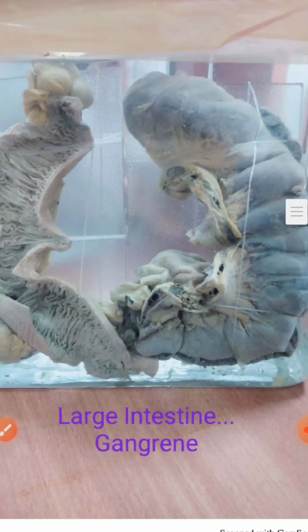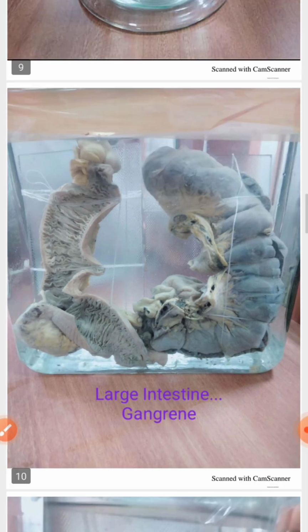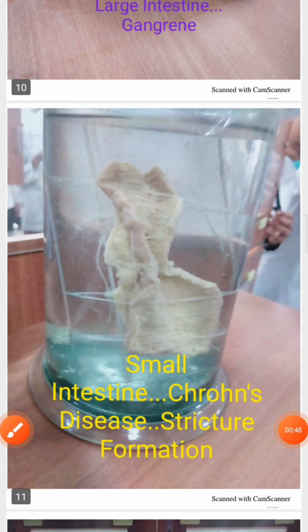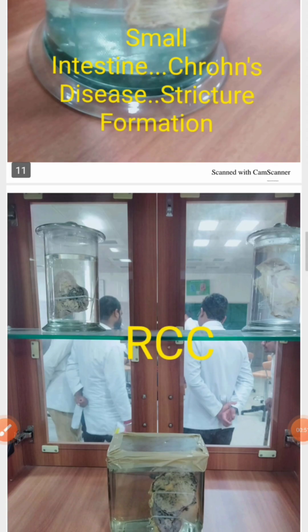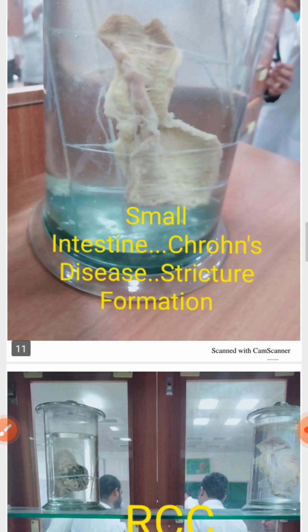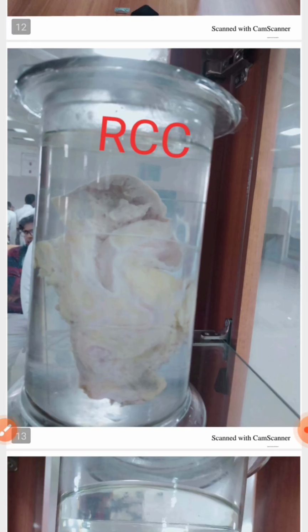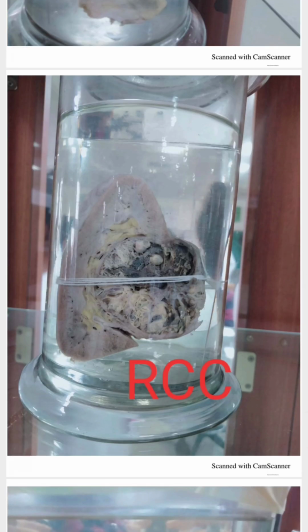So this one is a large intestine gangrene. Majority, whichever it is in your college, they might have already told which specimen it is. Most commonly these kinds of specimens will be very hard, so these things won't be kept. So this is a small intestine, most commonly Crohn's disease. You should know the difference between ulcerative colitis and Crohn's disease. If they kept this intestine, large intestine or small intestine, most commonly they will ask the difference between ulcerative colitis and Crohn's disease. Okay, renal cell carcinoma, most common at every place, every college.